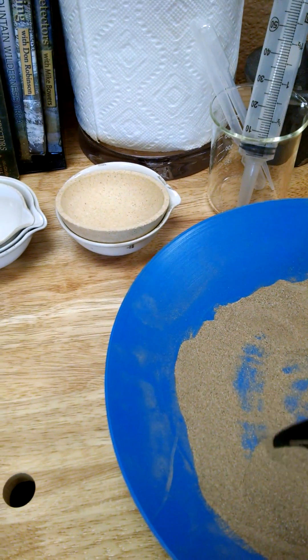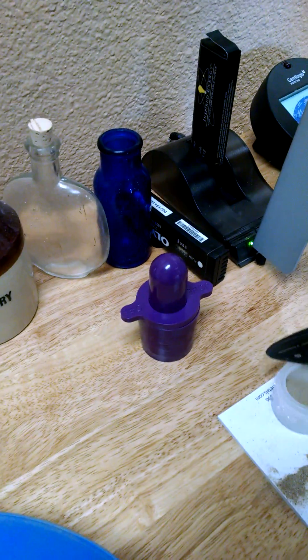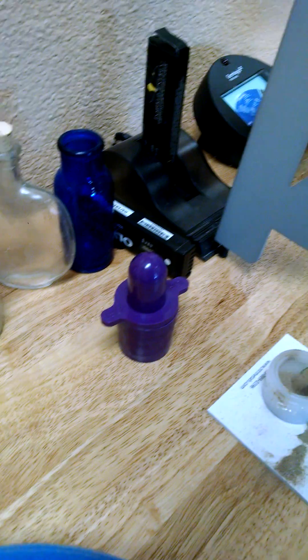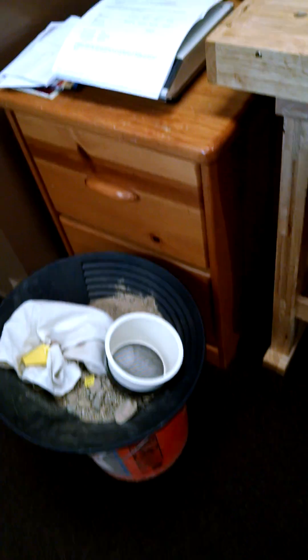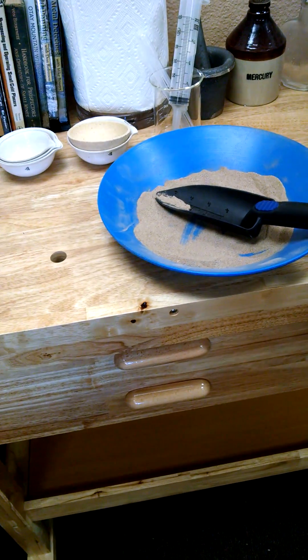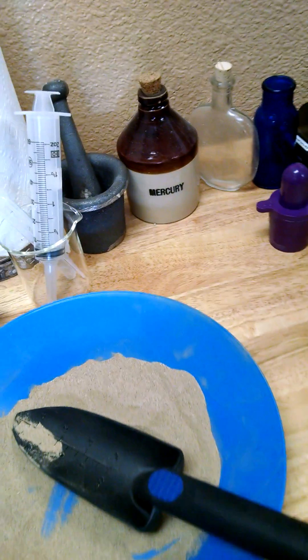So what we did today, we prepared the material. I'm just going to take some of it right here — we only need not much more than an ounce or so in our cup. We've taken that sample from that bag. I ground it up, pulled the big rocks out. I didn't want to analyze the rocks. I just wanted to analyze the clay-type stuff and the softer material, just like we would normally be dry washing.